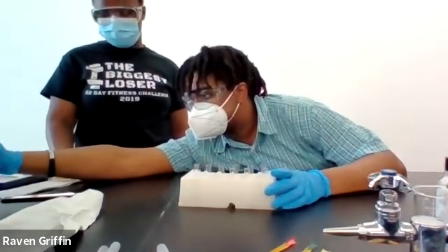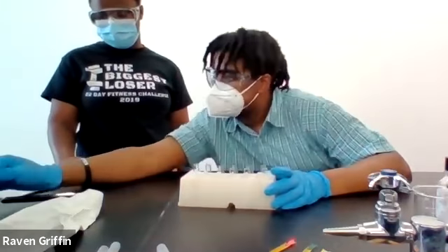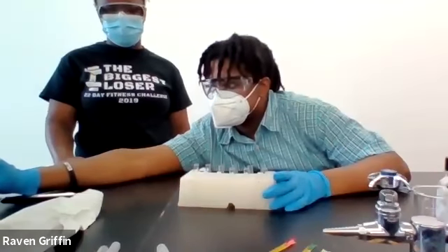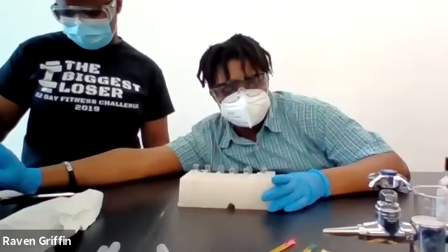What's supposed to happen? Just observations. Is this just an extra part of the lab? Like we don't have to write any data on this? This is part D. We don't have D2. We only have D1. You don't have D2 either. No. Yeah, okay. You can make a little table on the backside and just write it down that way.